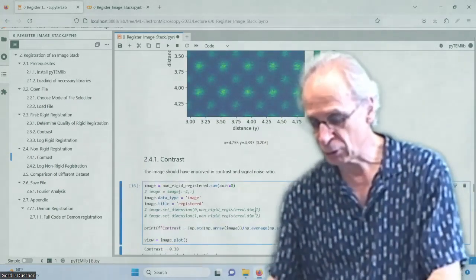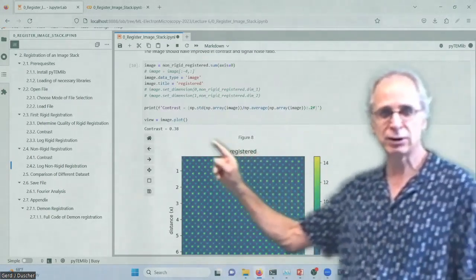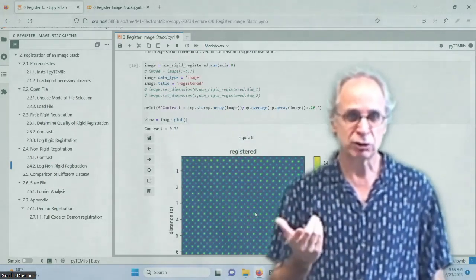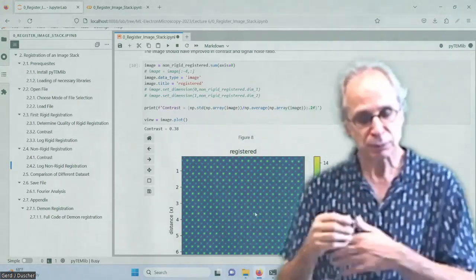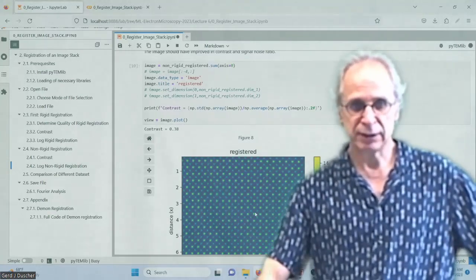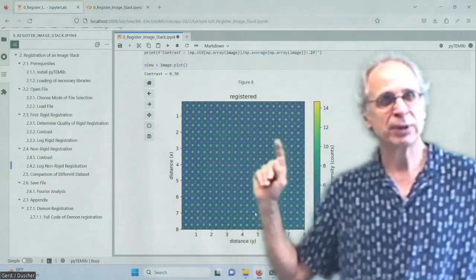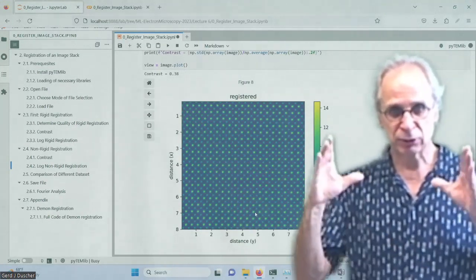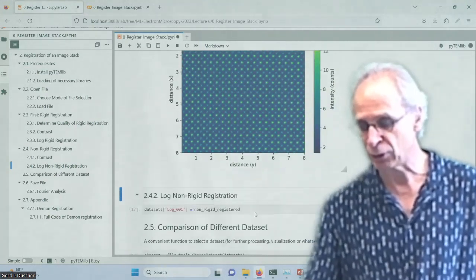And we can look now at the contrast, and from 0.36, we get 0.38. So we increase the contrast. Contrast increase is if you are using a little bit more noisy data. And then you get a much better contrast increase. But you will get in contrast in that kind of order if you do a fair amount of stacks with the Demon registration. So the noise is basically gone.